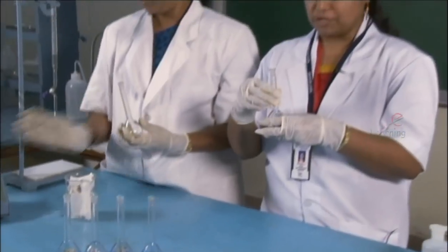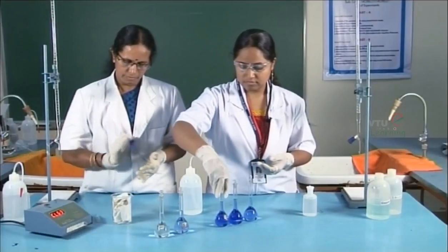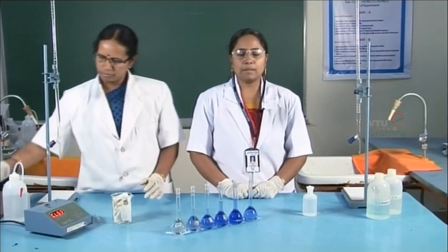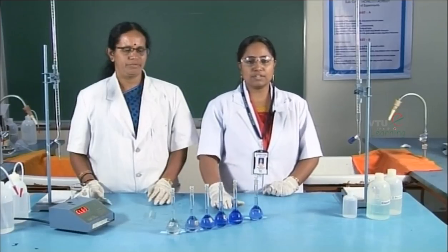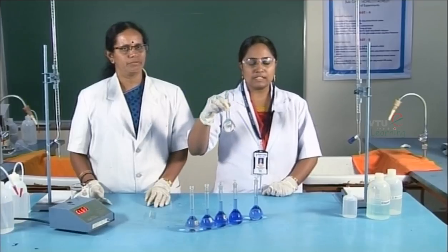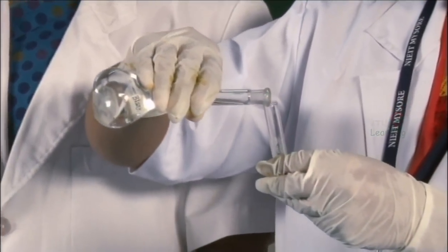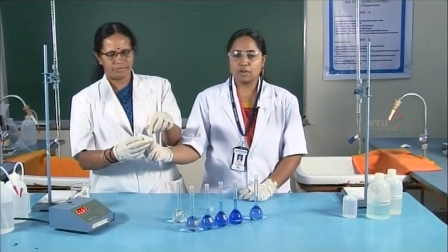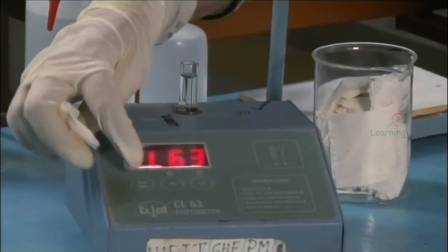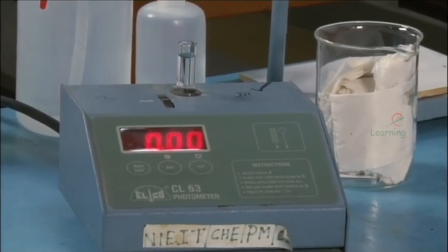Now we will make the solutions up to the mark. After making the solutions up to the mark, the solutions have to be shaken well and kept aside for 5 to 10 minutes. After that, the instrument has to be calibrated by fixing the absorbance of the blank solution to 0. The blank solution is transferred into the cuvette and the absorbance is set to 0 by pressing auto zero on the instrument. The absorbance of the blank solution is now fixed to 0.